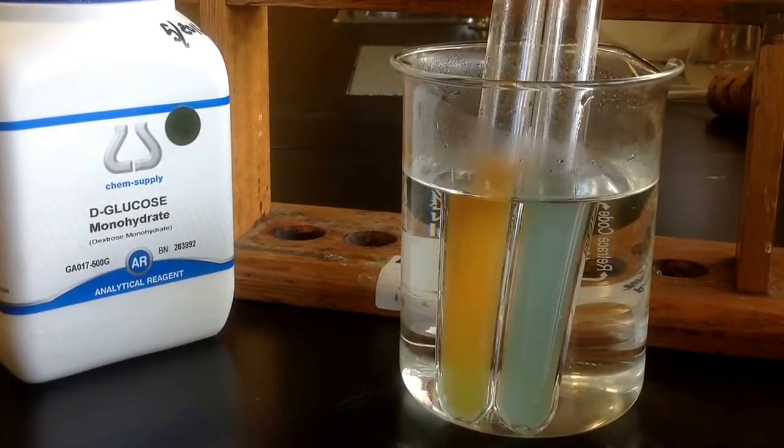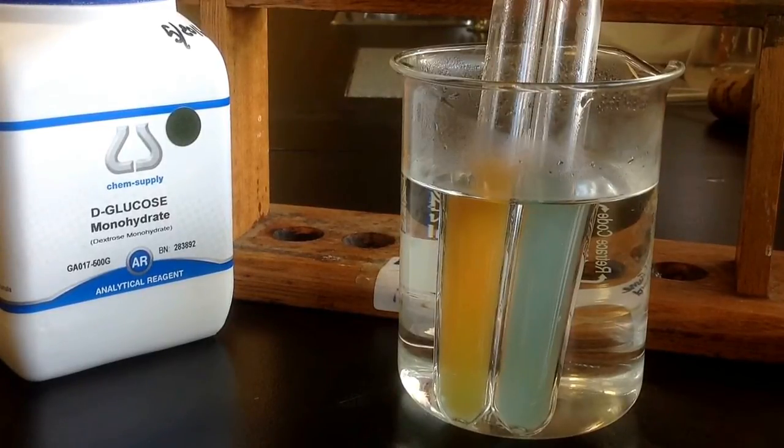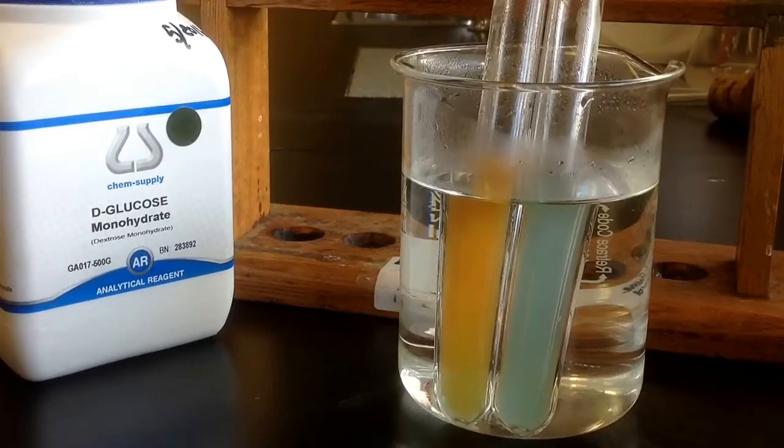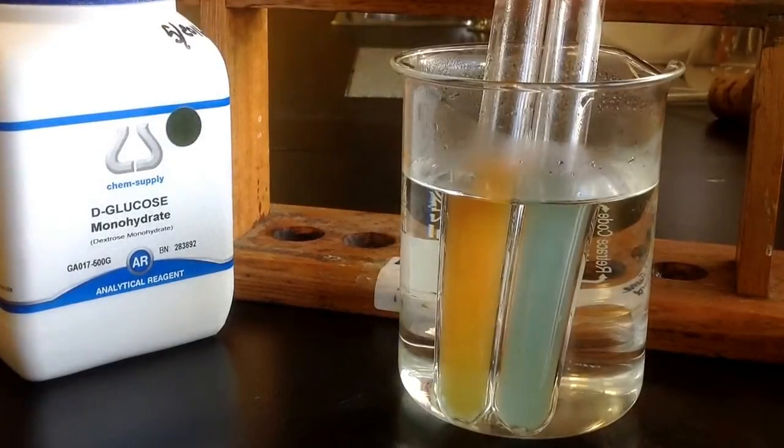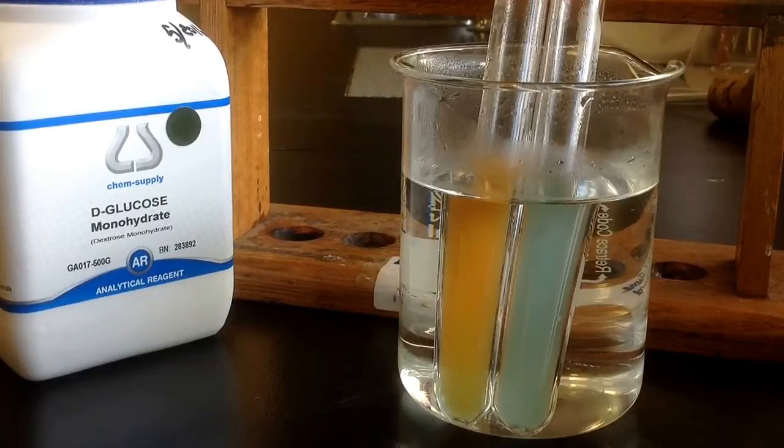Welcome back. So this is the test that I set up. Part two of it is after about five, ten minutes, nice little quick bathroom break. You can actually see my test, Benedict's test for reducing sugars as it worked quite well.